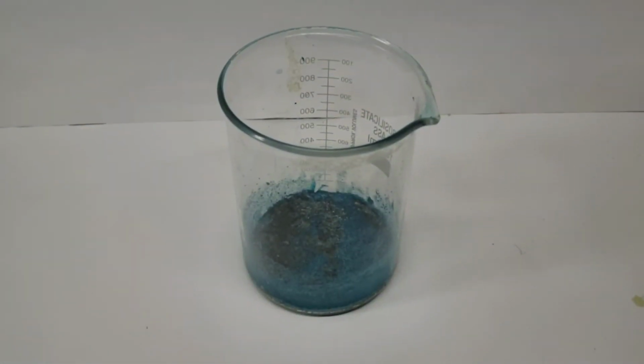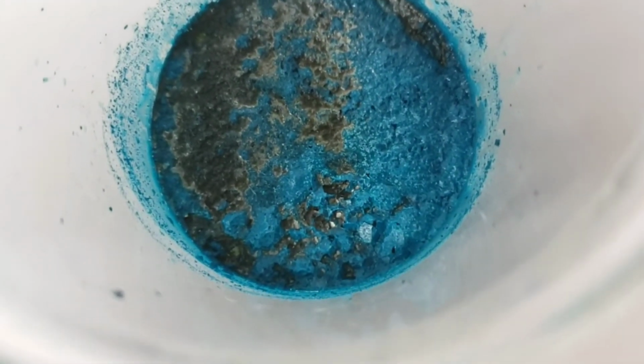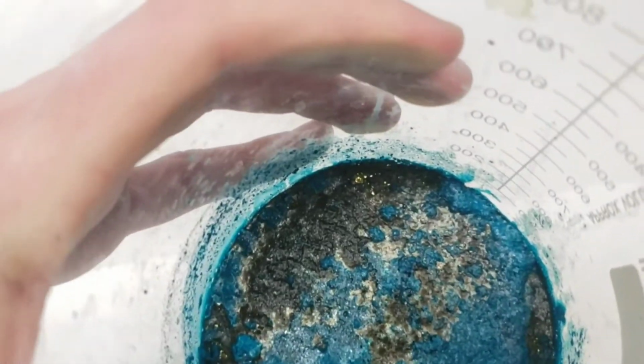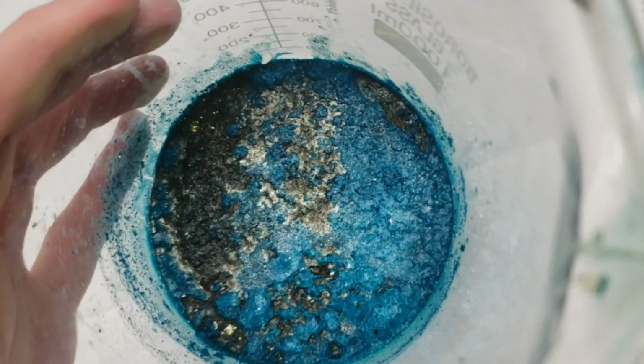But I made a mistake. Again. I let it run too hot for too long, and even though it was on a hot plate, I still managed to burn the crystals. What I'm pretty sure happened here is that they just sort of decomposed, and I'm left with some copper acetate, but also a bunch of just carbon. Which I think is a pretty reasonable assumption, considering that the decomposition temperature of copper acetate is only 168 degrees Celsius. Still, I think it looks pretty cool though.